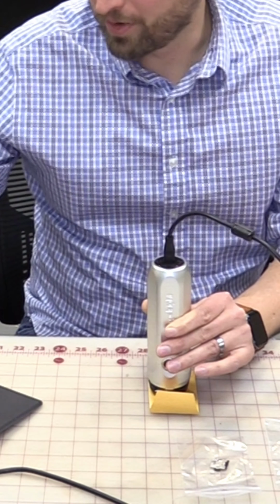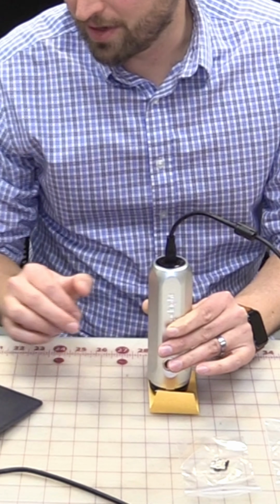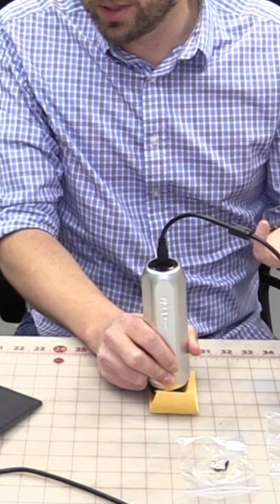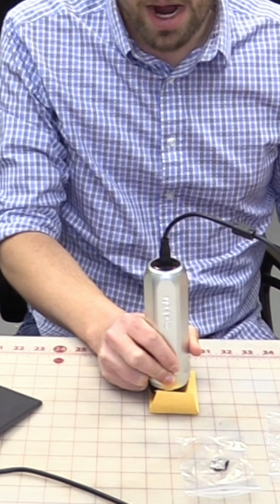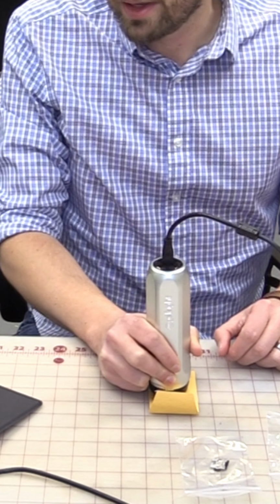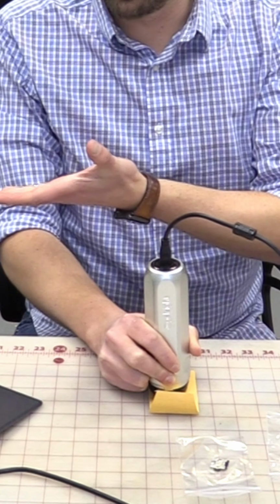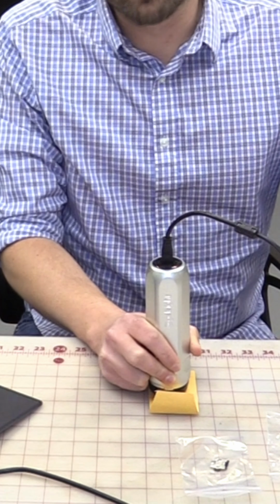Focus there. So these are all of our dimples that you can see have been stretching out and deforming over time. In this case, we're able to use GelSight to really definitively show that this was not a one-time overstress event. This was not an over-temperature event that would have caused the solder to melt. This is actually a different case of high stress over a long period of time, causing that solder to slowly stretch and deform.